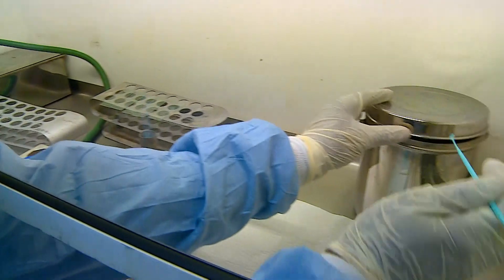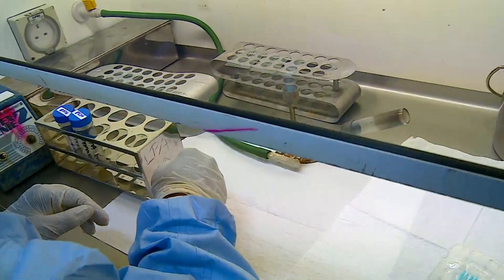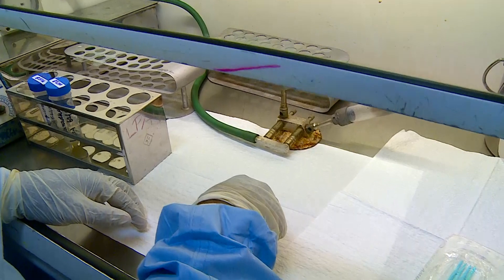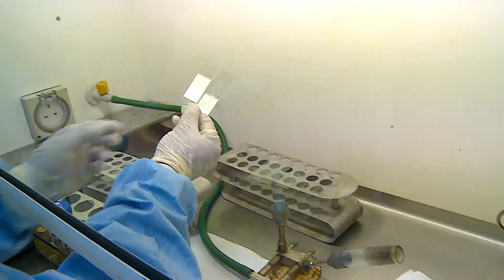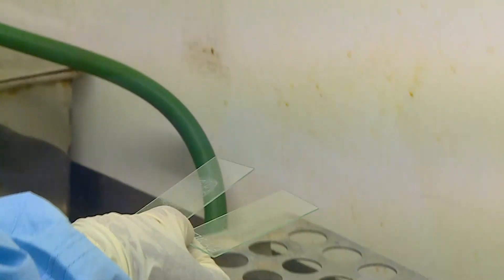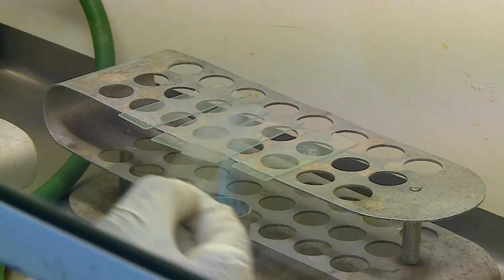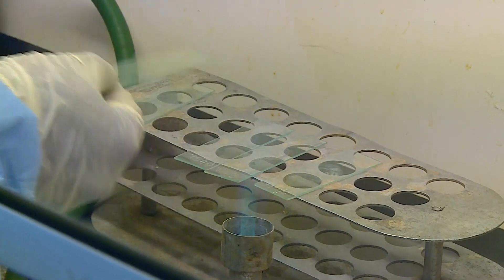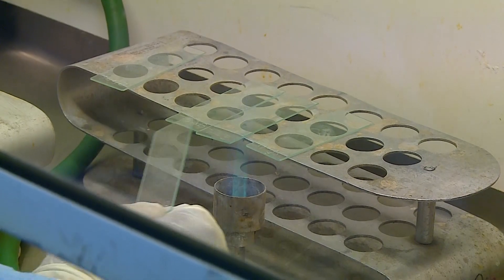The smear should neither be thick nor thin. The smear is then left to air dry in the cabinet so that it is completely air dried and no aerosols are present when the smear is fixed using heat. Here we have a completely air dried smear — it does not have any air bubbles or wet material. Fixing of the smear to the slide can be done by passing the smear 3 times over the flame or by keeping it on a hot plate at 95 degrees for 5 minutes. It is now ready for staining.